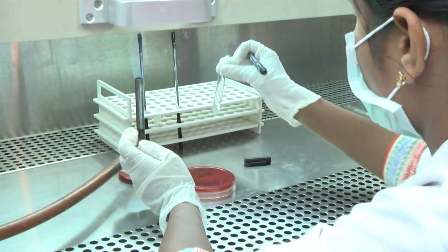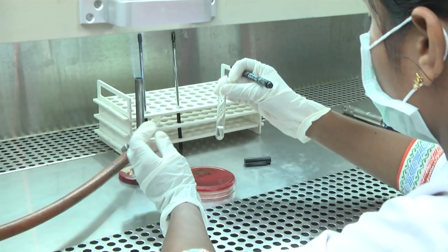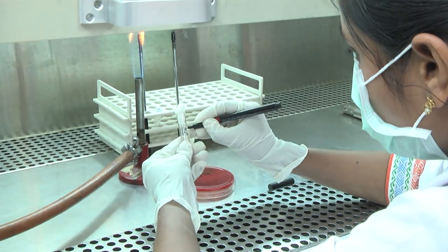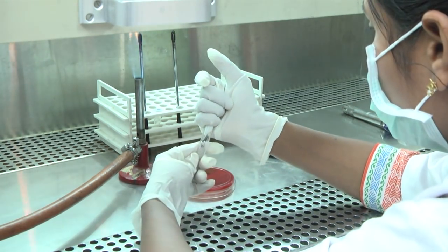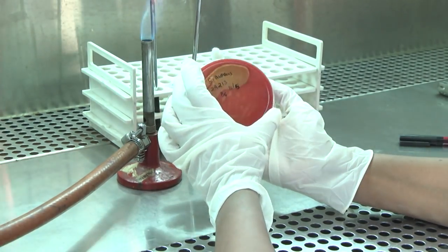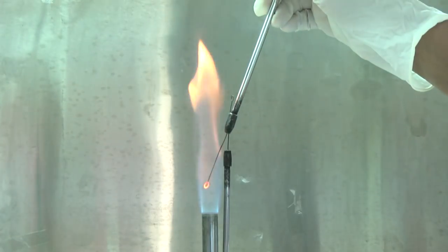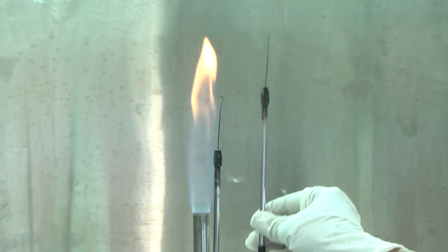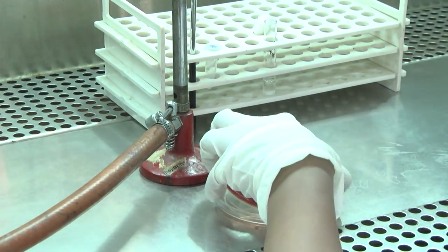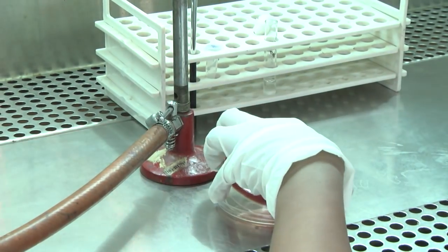Take any suitable sterile liquid medium like peptone water or BHI broth and label it before inoculation. Loosen the plug or cap. Keep the specimen or culture plate from which a colony has to be inoculated ready. Sterilize your inoculating loop and allow it to cool down. Remove the lid of the culture plate and pick an isolated colony. Replace the lid.